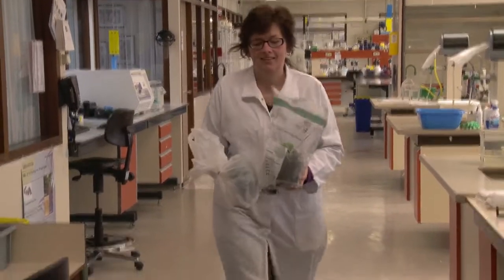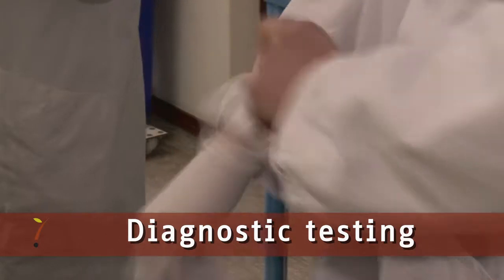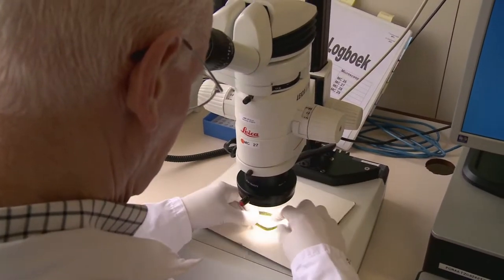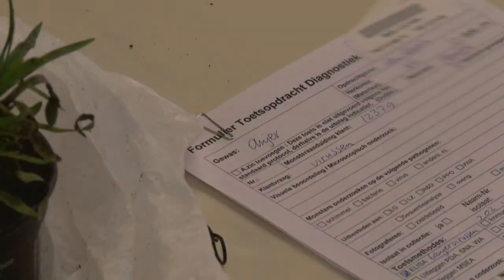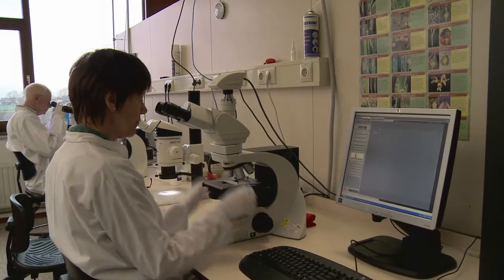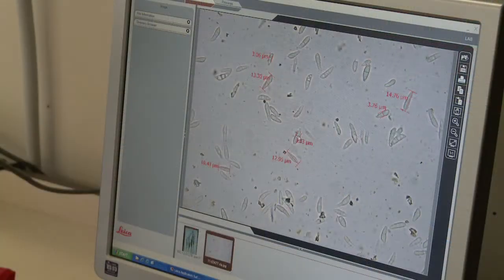Sometimes a plant may show symptoms of a disease that cannot be identified. These plants can be examined in the Diagnostic Laboratory of Naktuinbouw. Plant material from all over the world is sent to the Diagnostics Laboratory. After an initial diagnosis, the expert decides which pathogens to test for. Pre-treated material is plated out on a selective growth medium and, after a specified incubation time, examined.